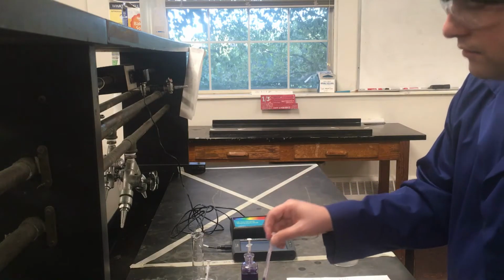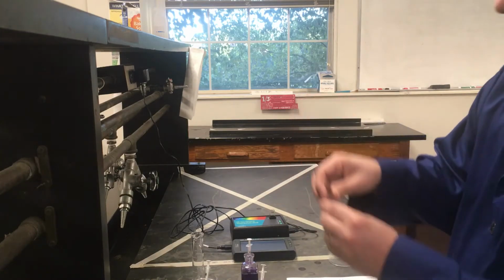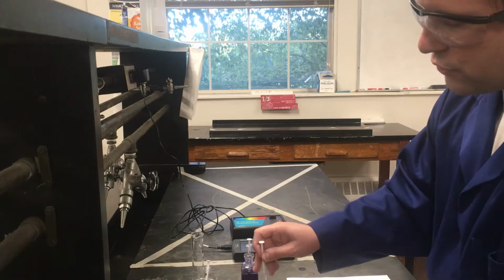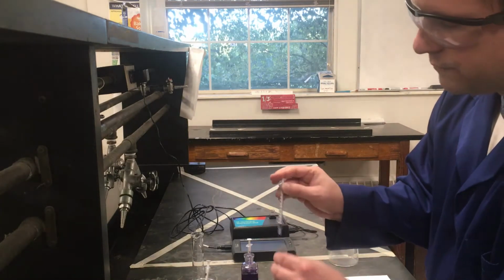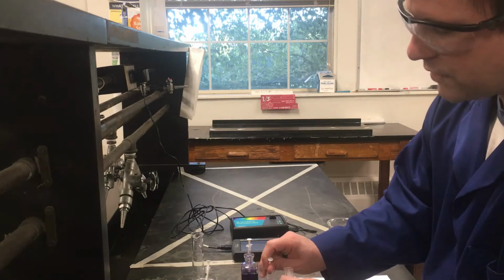For filling up the cuvettes, the only thing you really have to look out for is you really just want them above where your slits are, just so that there's enough in there that it covers all the area where the light's really going to be passing through. So there's not a definitive specific volume you have to have. It's probably somewhere between 2 and 3 milliliters should be plenty. So 1 milliliter almost filled what I need right there. I can probably just do a 2nd milliliter and that should be plenty for what I'll need for my measurements.